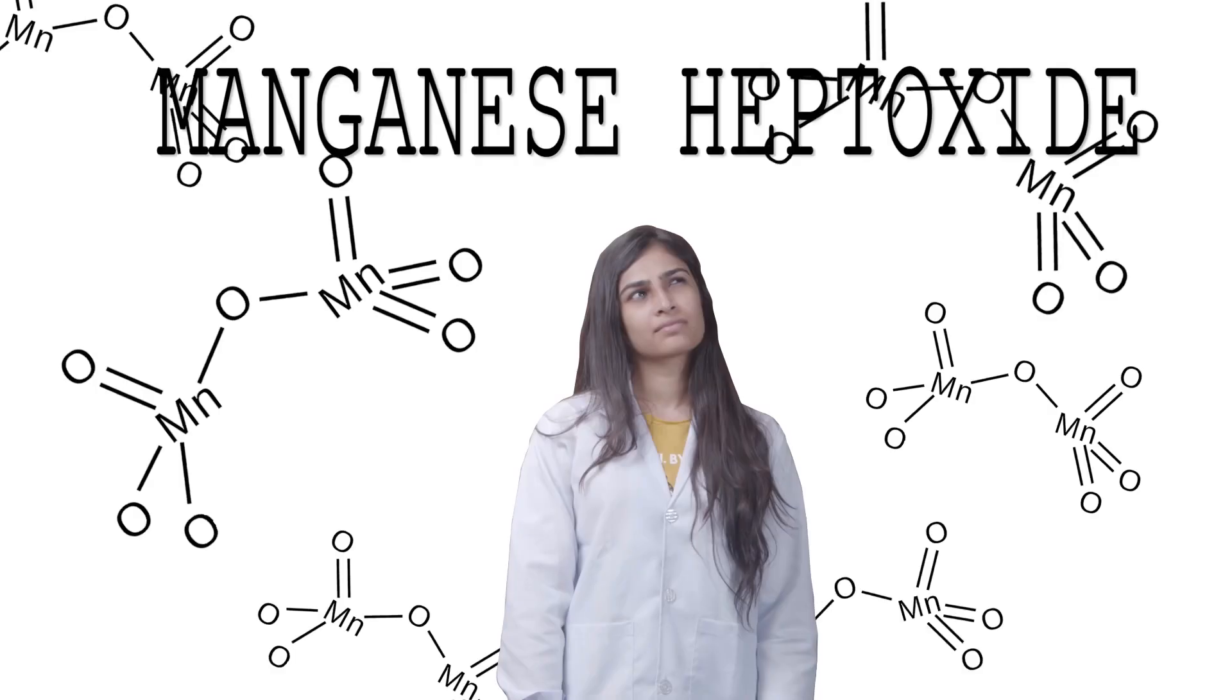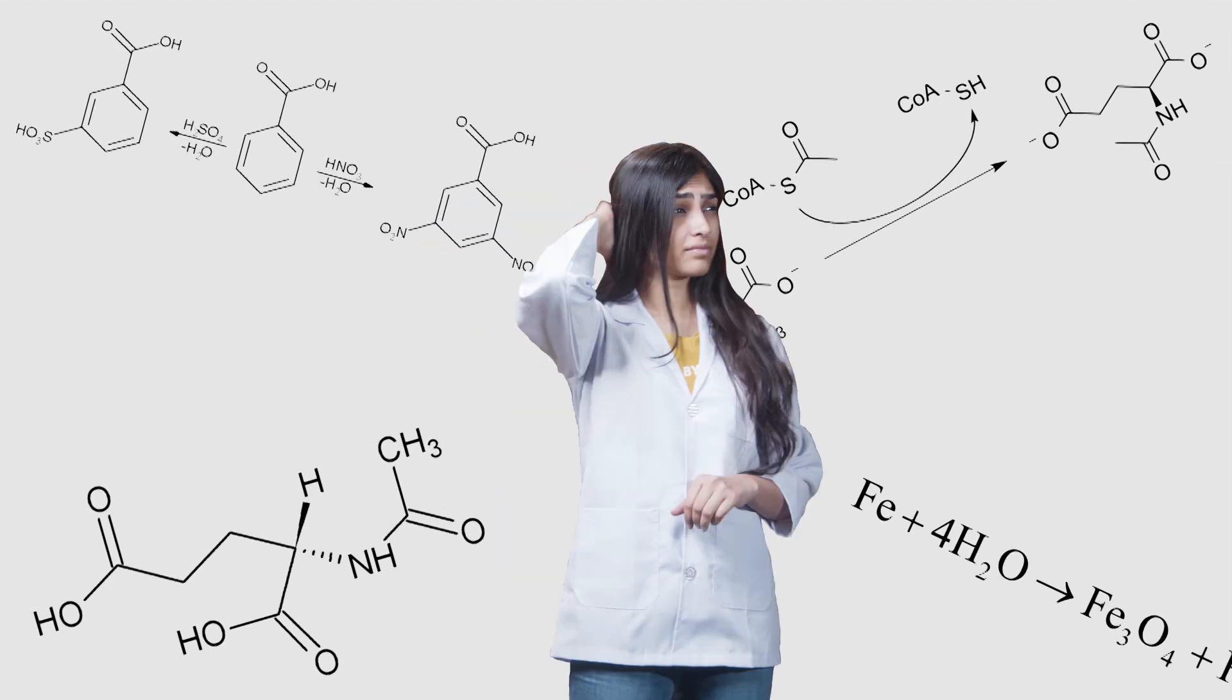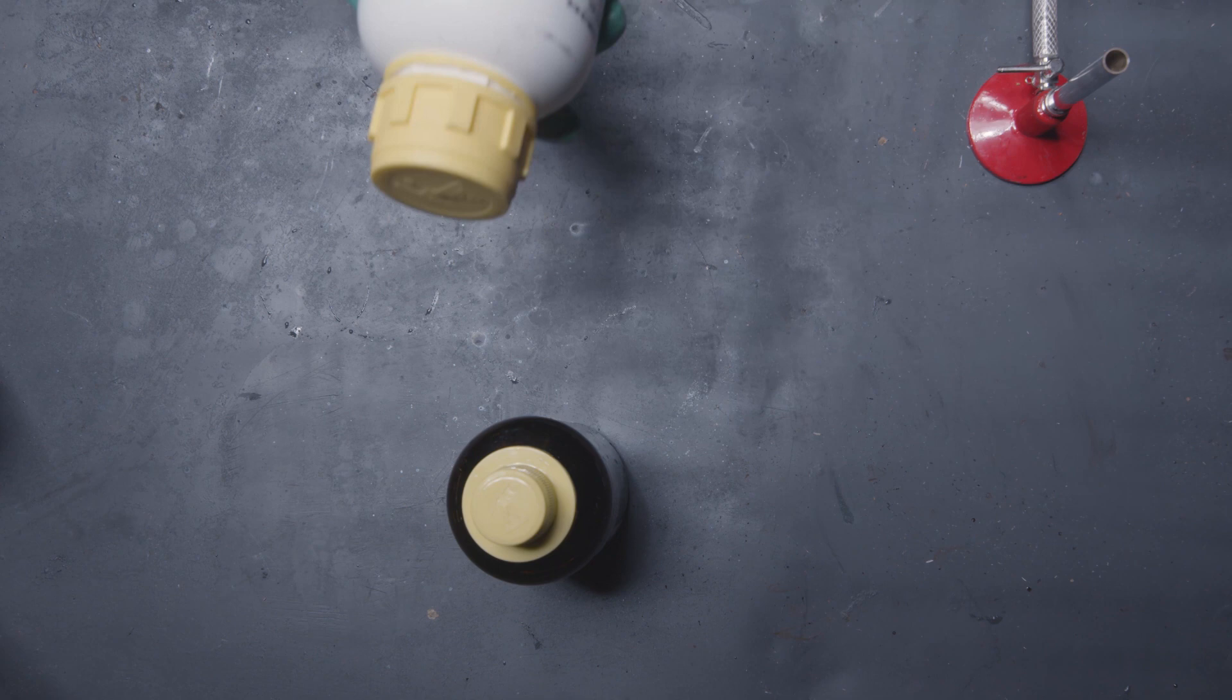Have you guys ever heard of manganese heptoxide? I'm sure you haven't. I mean, who listens to confusing chemical names in school when there's plenty of juicy gossip to go around? Relax, let me see how I can make this fun for you.